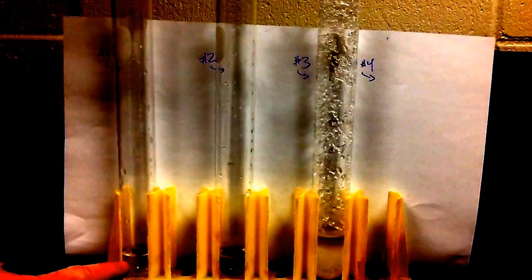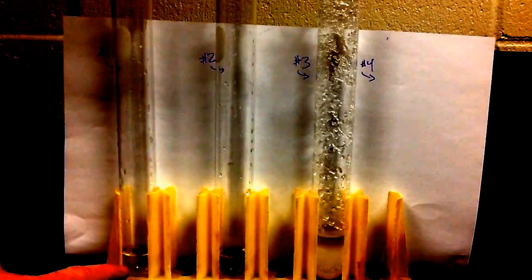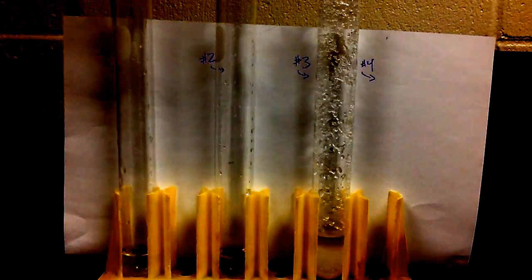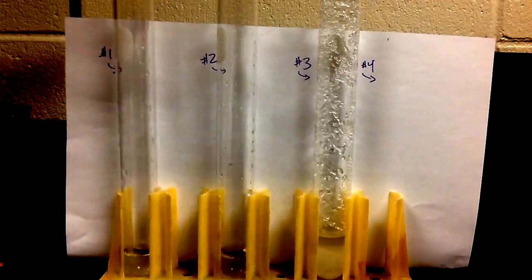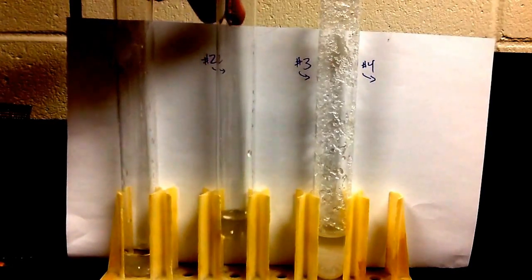So in test tube number one, I'm wondering, is this solution saturated? What we need to do to check that is add another 0.5 grams of sodium acetate. So we do that, and we shake it up, and guess what, it all dissolved.